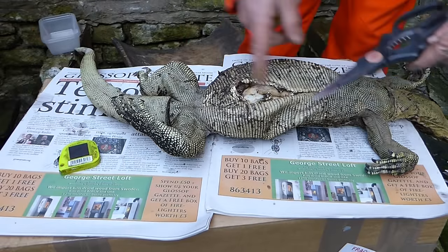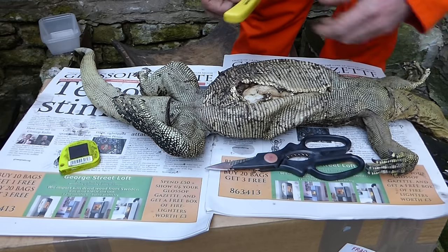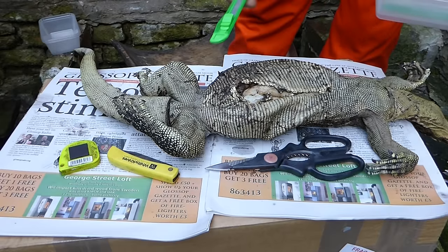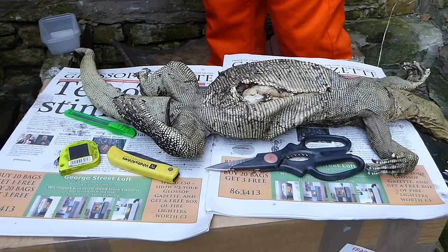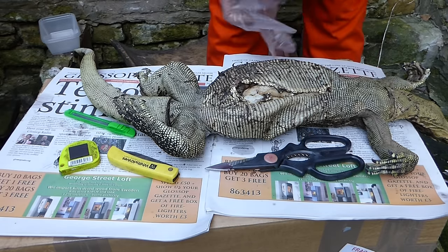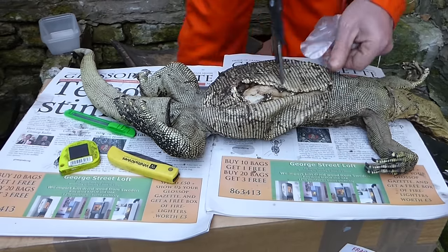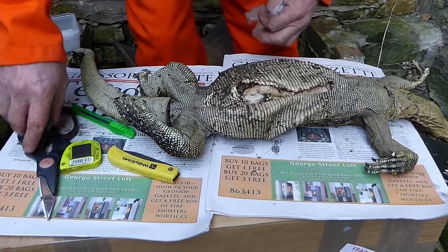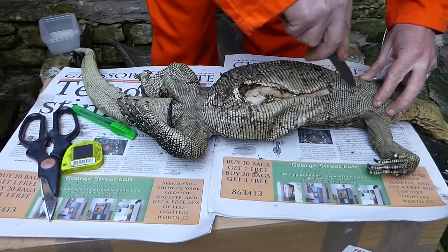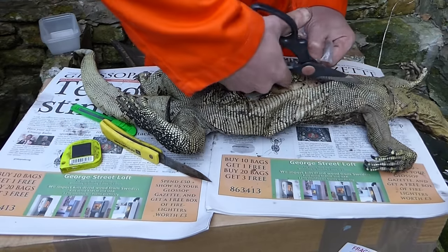What we need to cut open this lizard is actually — it's cut open already, so we'll use a pair of scissors. These ones are very dangerous; we only use these when we really have to. Gloves help — it's a shame they're not insulators. Let's just see how frozen this is inside. It's not that frozen, not that bad. So if it was intact, what we'd do is cut away there until we had a hole, then cut it all the way down — once you've got a hole in it, it's much easier to use scissors.